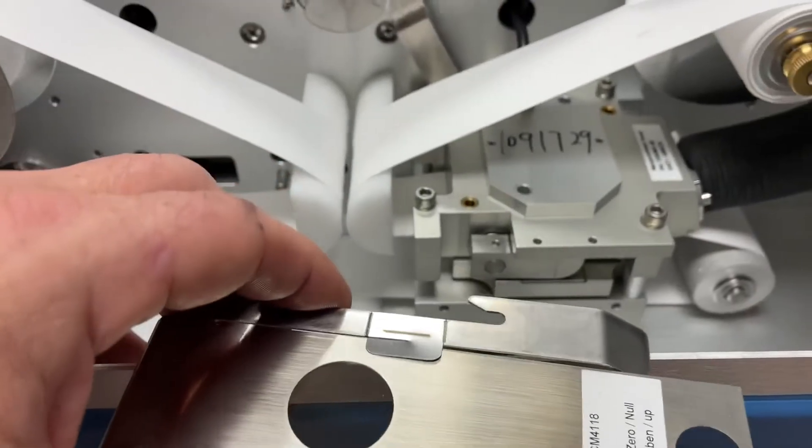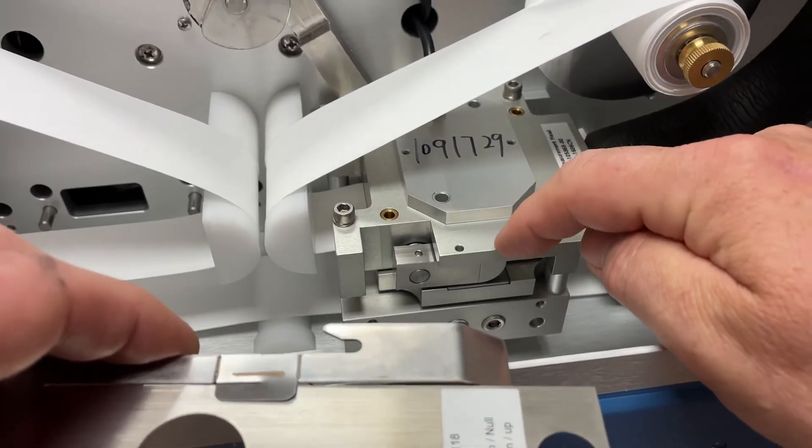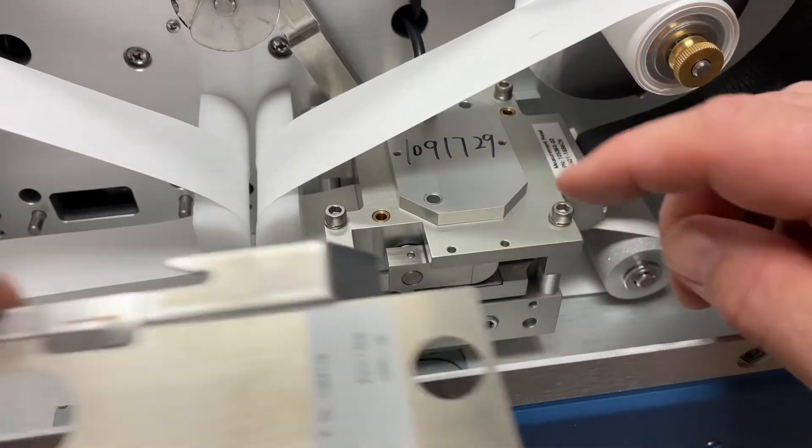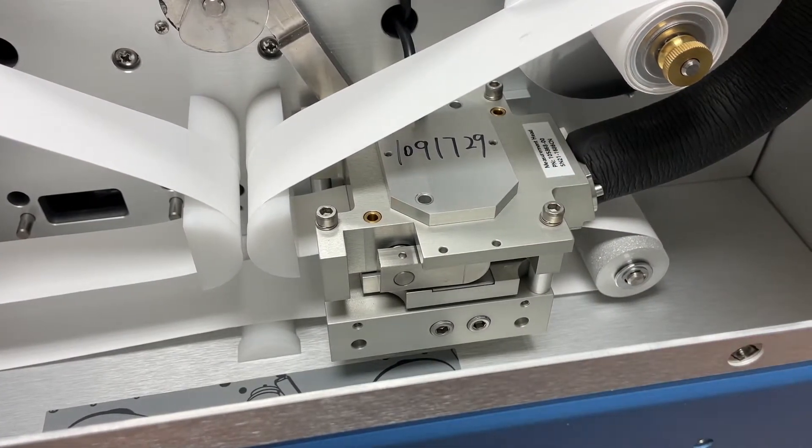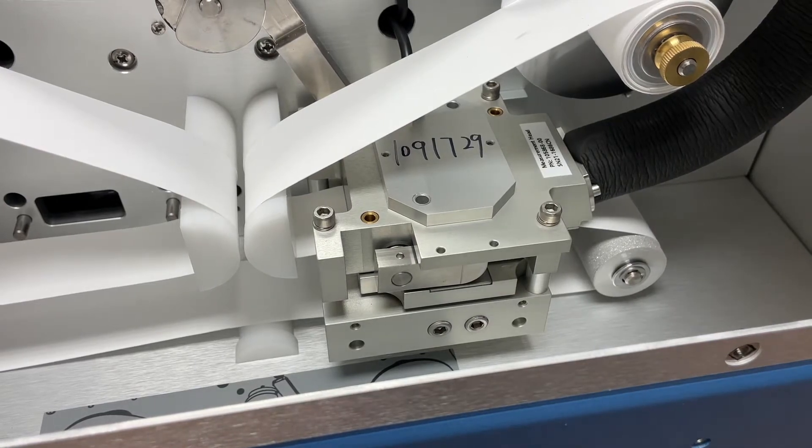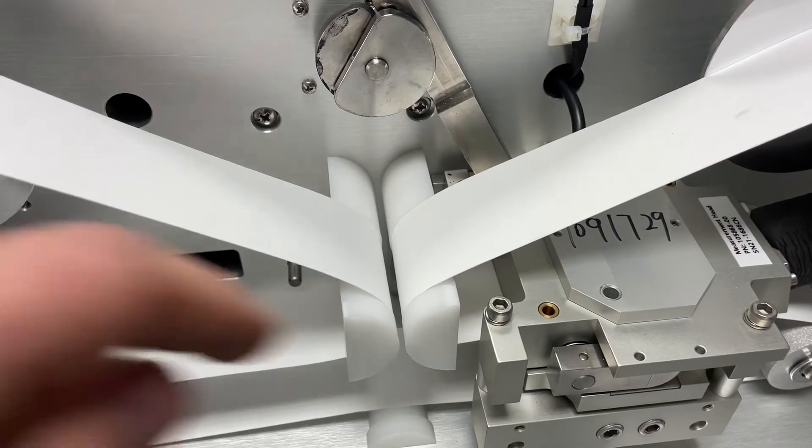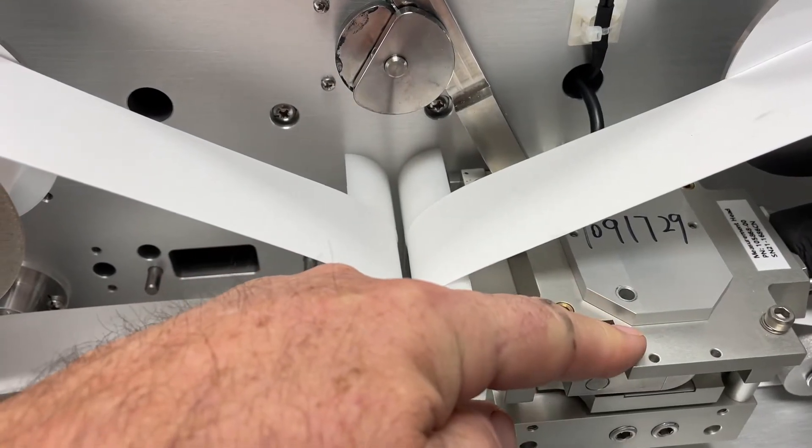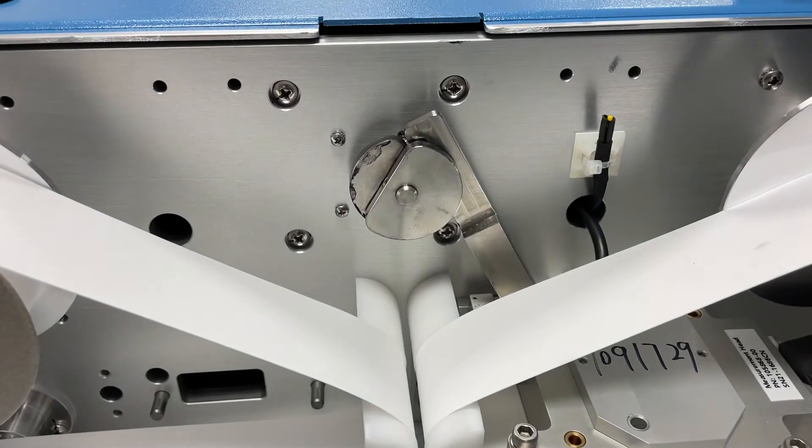I'll show you that over here. We're going to insert it underneath in between this detector right here, but before we can do that we need to open the sensor head just like I did in a previous video. The detector head needs to be lifted and raised. I'll press enter on the front of this analyzer.